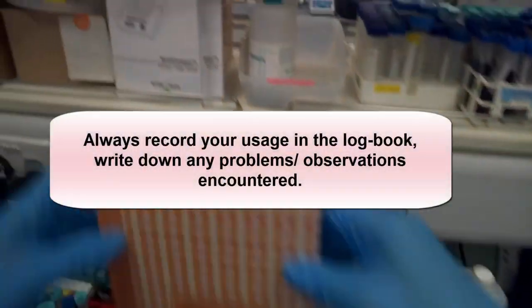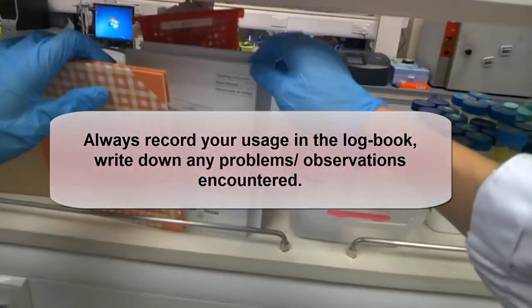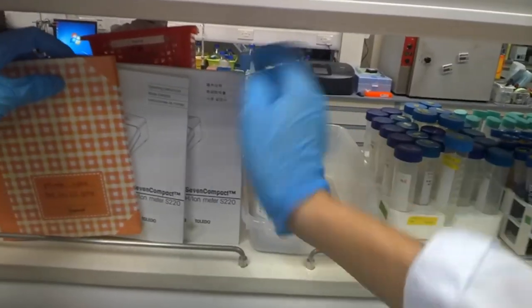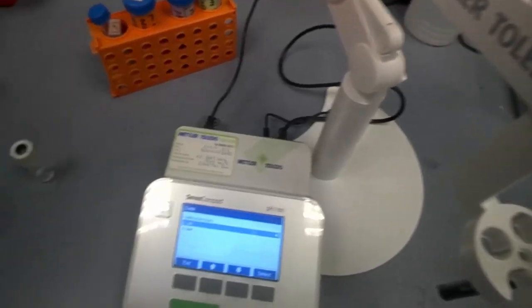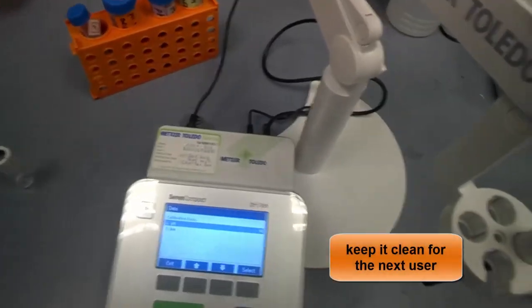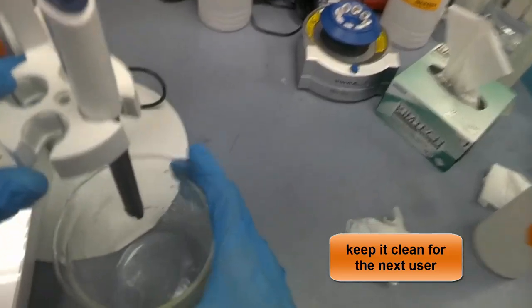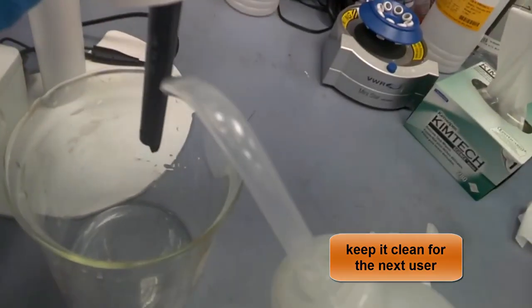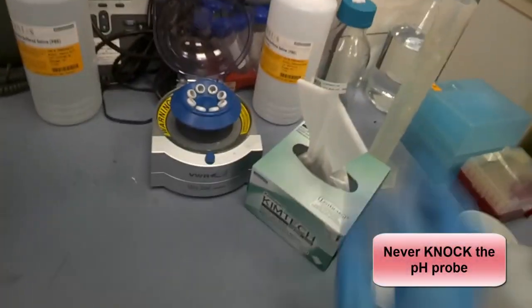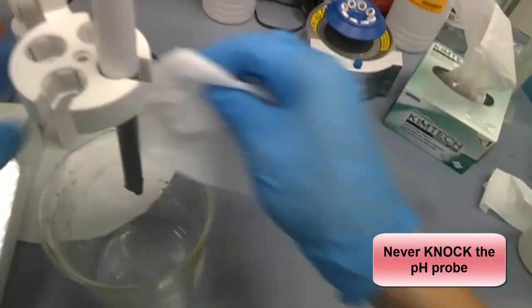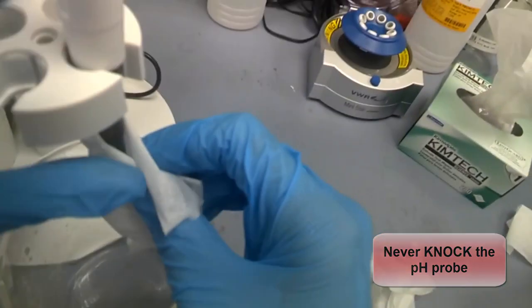So after you're done, please put this book back over here. And if you're still not sure, there are instructional manuals over here in three different languages. No excuse if you can't read them. And most importantly, after you have measured it, you need to do some housekeeping. Rinse the pH probe with DI water once more so that the next user will have it clean. We do not want to see our pH probe and pH meter to be dirty when we use it.